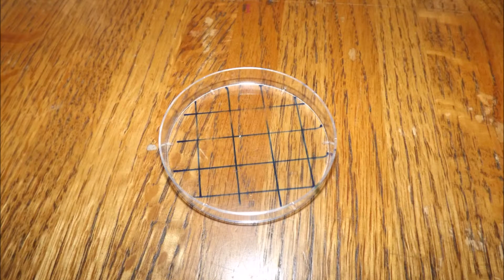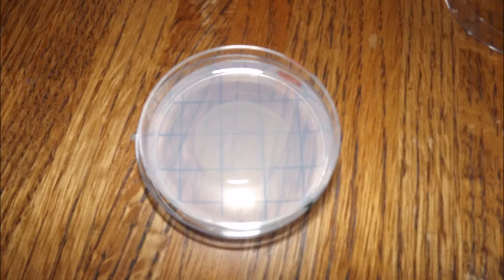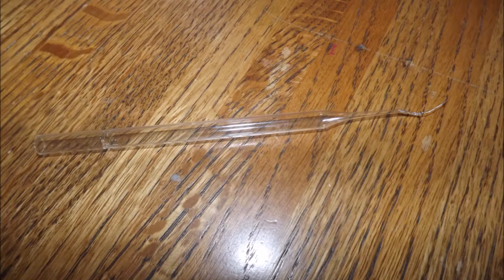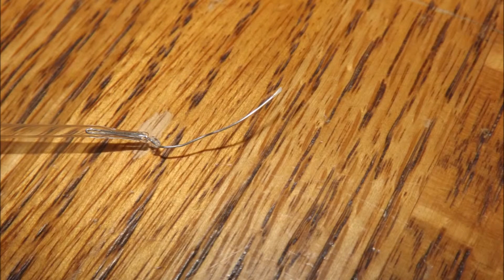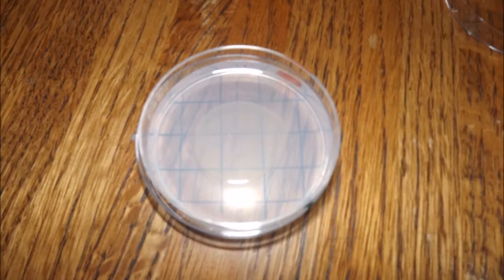Scoring a lifespan accurately is a very important part of running one. To do so, you lay a lid with a grid under the plate you are counting, and then carefully mark down each live worm. For the dead worms, you use a worm pick and remove them from the plate. A worm pick is designed with a flat tip to make moving the worms easier. You repeat this process of counting and removing worms until all worms are dead, and the amount of time this takes gives you your lifespan.